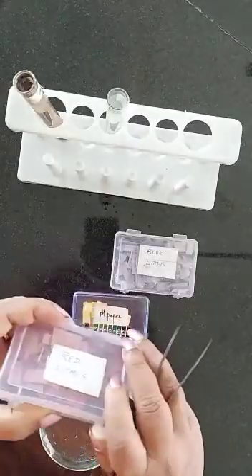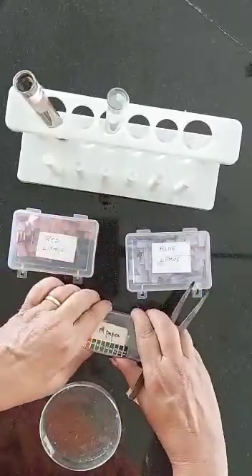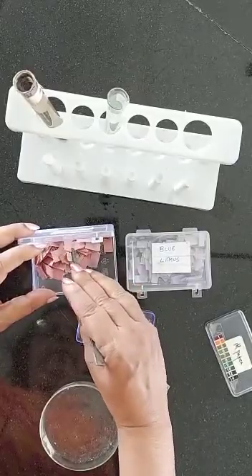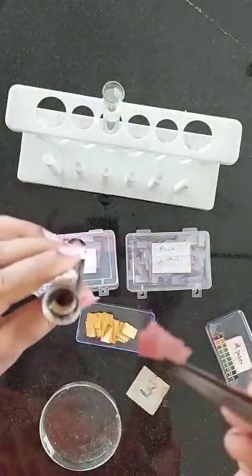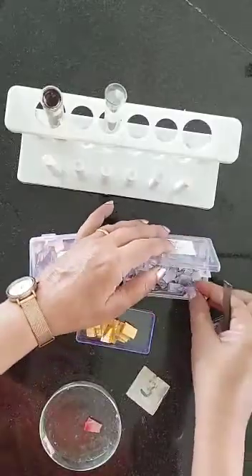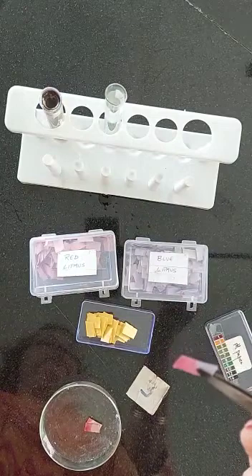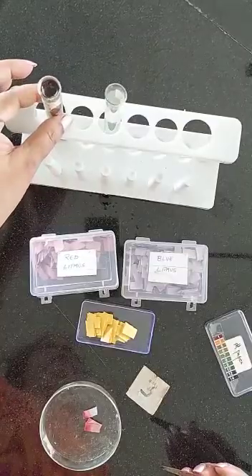Now you have to see what you get with the litmus papers and the pH paper using each solution individually. I take red litmus paper — I take a piece using a forcep and I dip the red litmus paper in solution A. Red litmus paper remained red. I take blue litmus paper and I dip it in solution A, and I notice that blue litmus paper turns red. So already I have an indication — if blue turns red, then A is an acid.